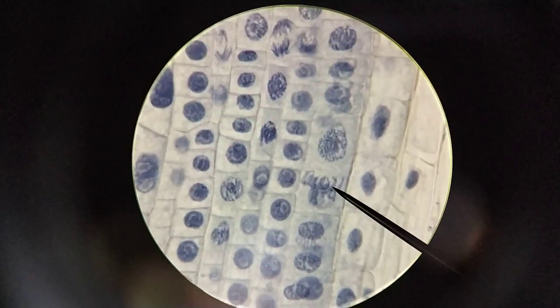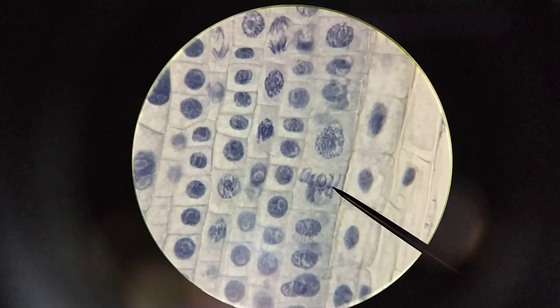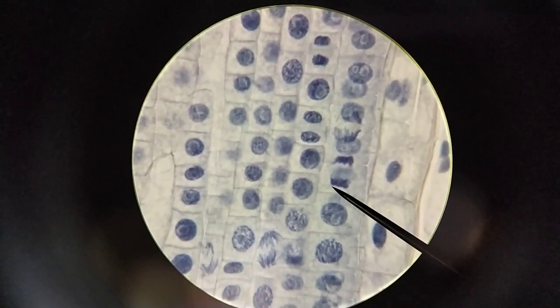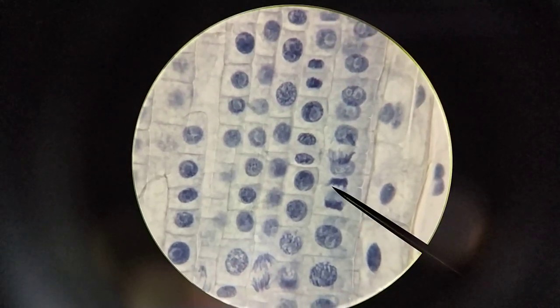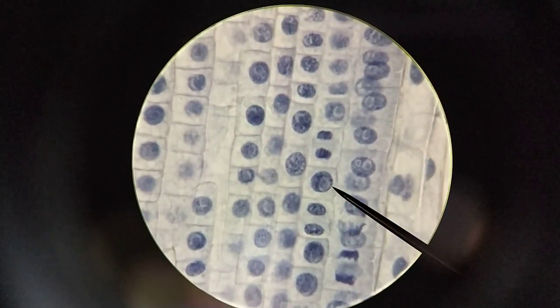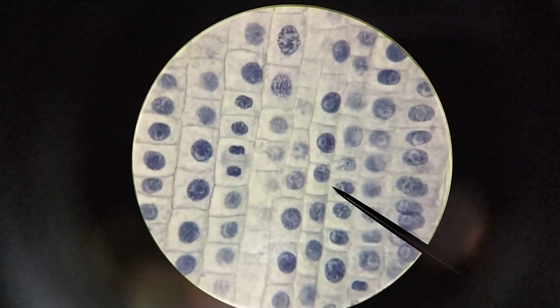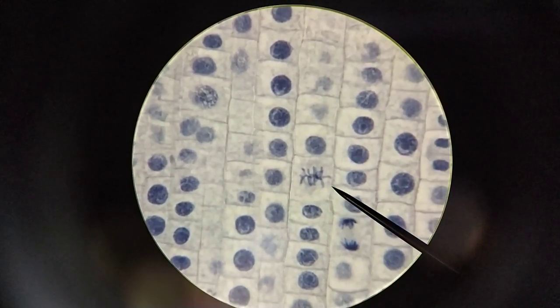The chromosomes have been pushed together into the middle region. Because they are long, they still have little strands poking toward the poles, but the centromeres have all been pushed into the middle. They've been caught by microtubules and are getting ready to separate. When they do separate, that is anaphase. Here we can see the chromosomes have been separated to opposite poles - two poles with chromosomes at either end. That's late anaphase. Here's another example where chromosomes are starting to form more rounded structures that will become the nuclei.